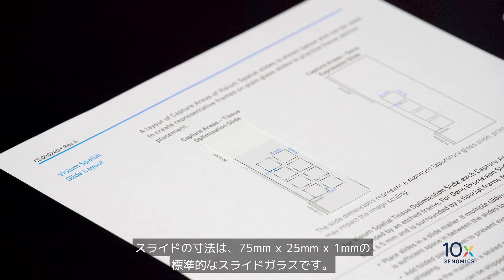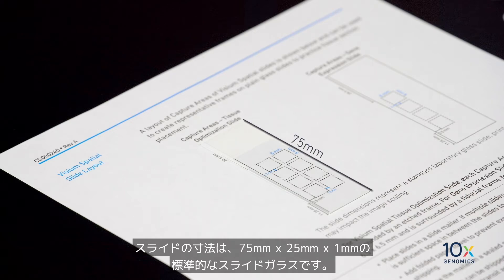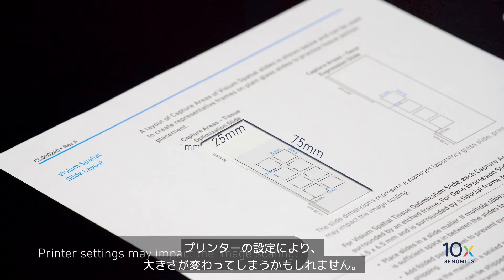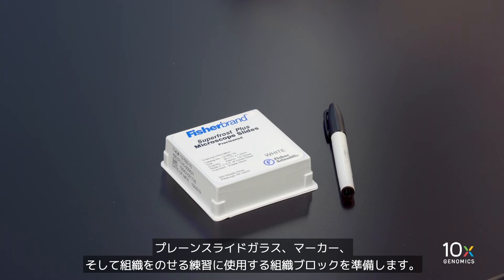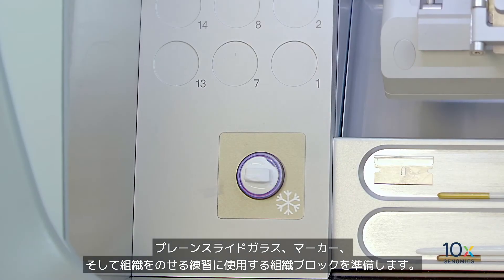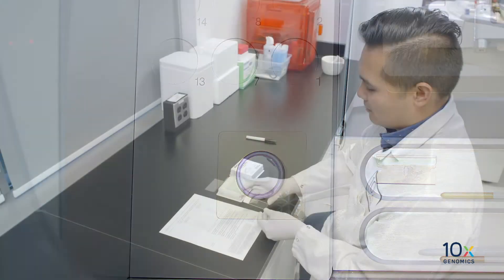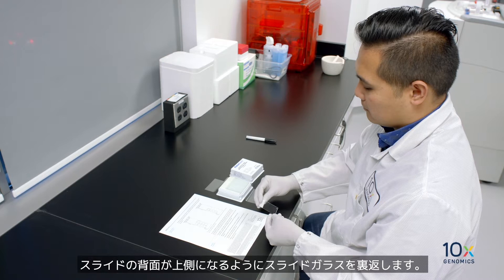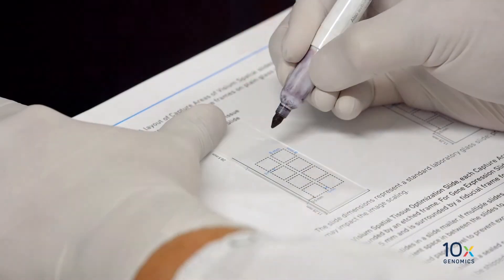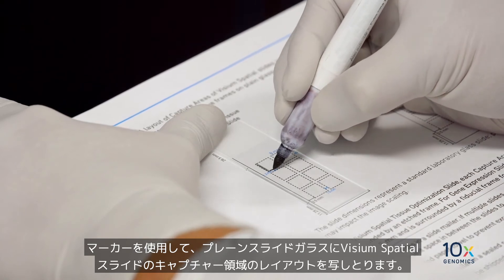The slide dimensions represent a standard laboratory glass slide of 75mm x 25mm x 1mm. Printer settings may impact the image scaling. We have plain glass slides, a marker, and an OCT embedded tissue block that we can use for practicing section placement. Flip the glass slide over so the back of the slide is facing up. Using the marker, trace the capture area layout of a Visium spatial slide on the plain glass slide.